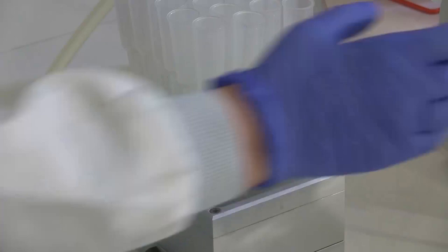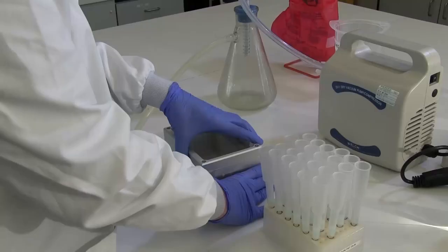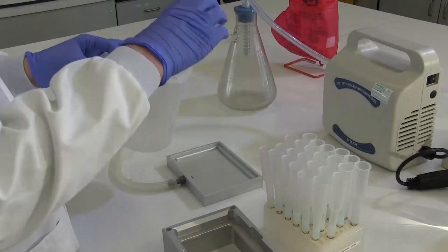Dispose of the contents of the collection plate into a waste box. Add three resin volumes of EDTA buffer to all the columns.